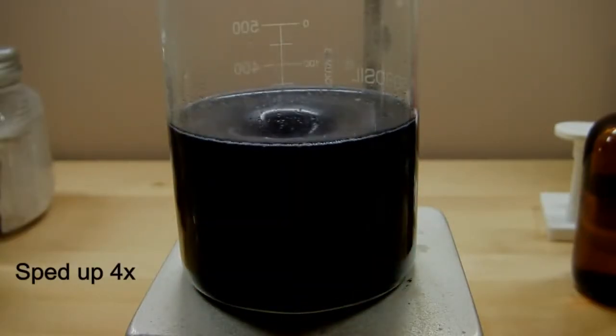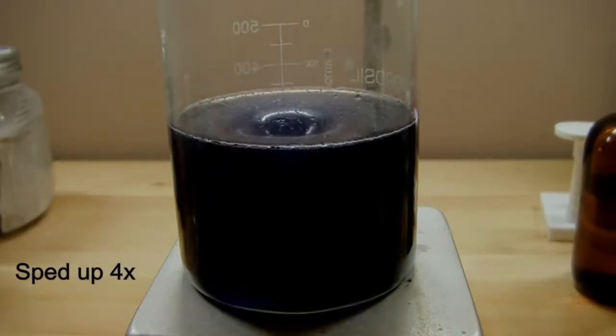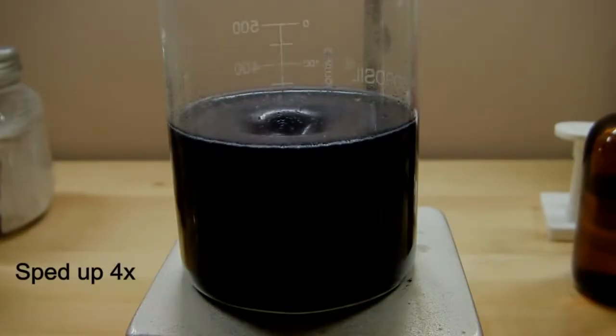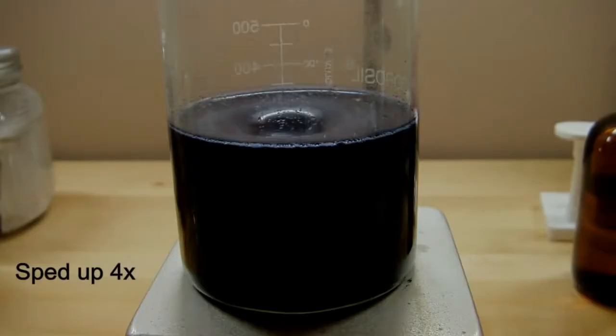Since this is slower, it does not produce HOI nearly as fast as the radical process, and iodide and iodine are consumed faster than they can be created. So that causes the blue to clear and the amber to fade back to relatively clear. Eventually the iodide concentration drops down low enough for the radical process to restart and the cycle starts over. This continues until the iodate or the peroxide is consumed.